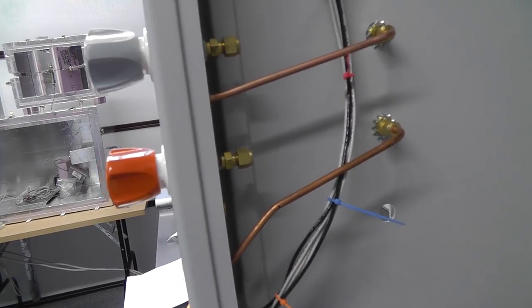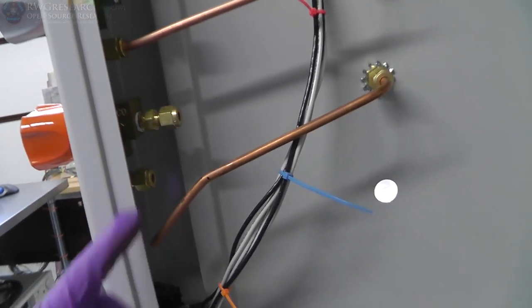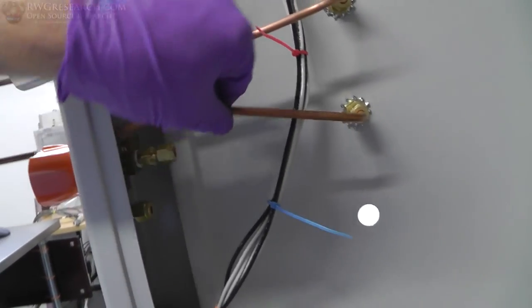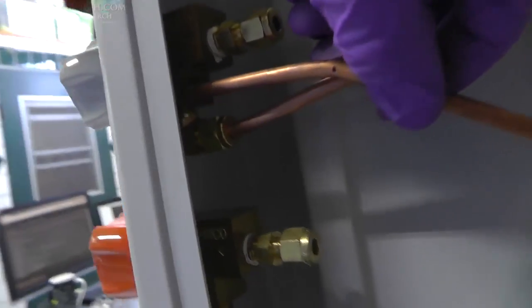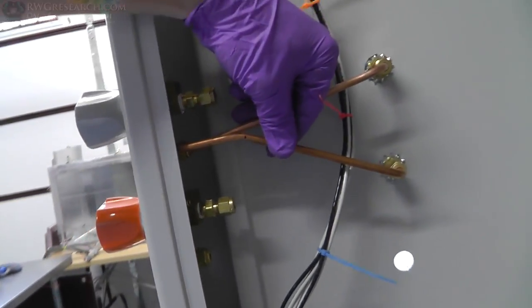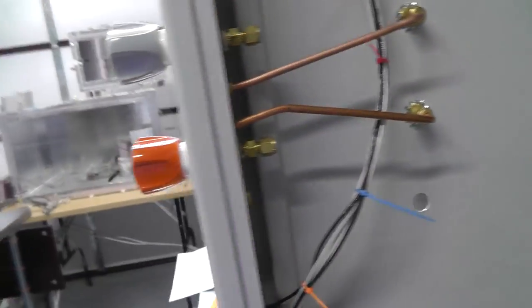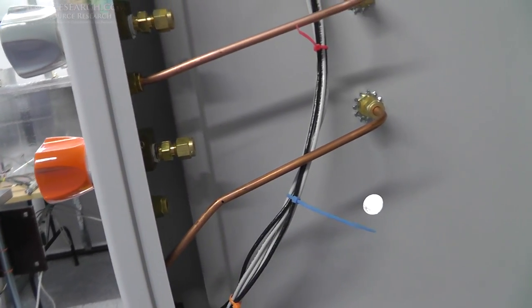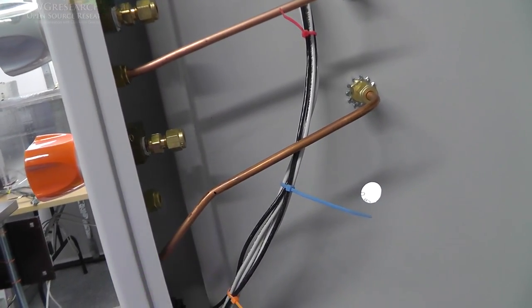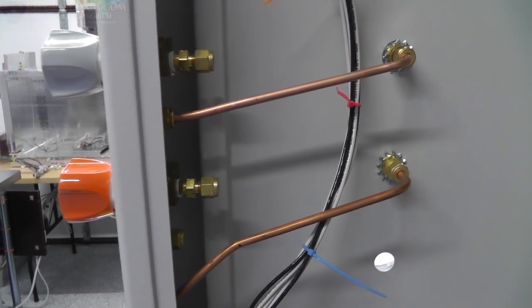Okay, I got the second one in. Now, once again, back to this silly pipe thing. The pipe's long enough, but look, it's bent the wrong way. So in theory, this one would fit here perfect. Actually, it's a little long, but that's fine. It's pretty well perfect. But that's not how it works. These three holes are specific for these three valves. Anyway, I'm kind of disappointed, but hey, I don't mind modifying things myself. It's just, this is a kit. This should be right. Yeah, well, enough complaining.